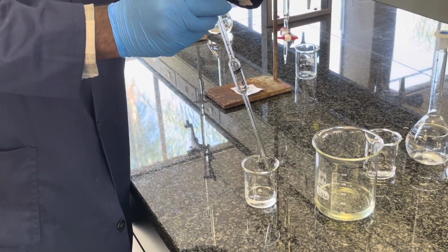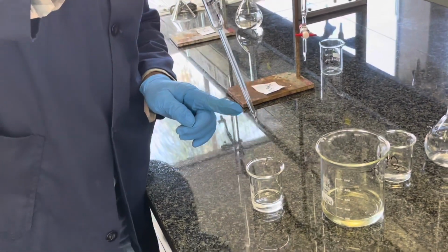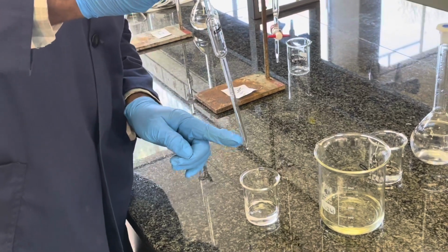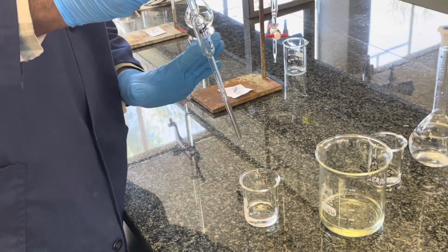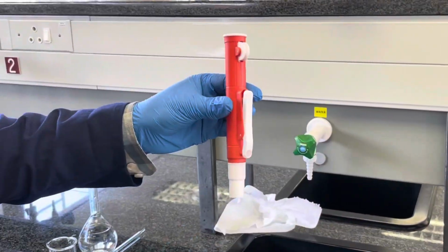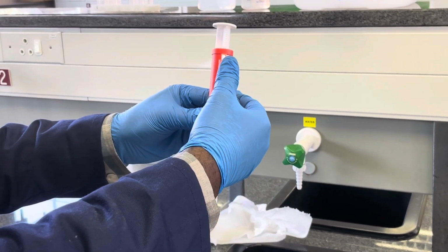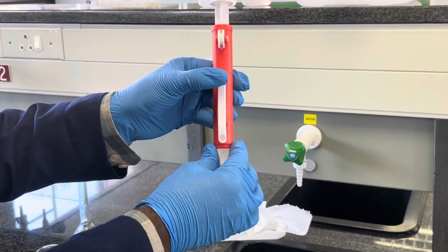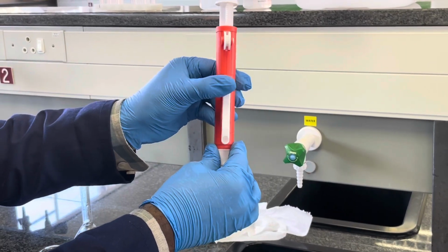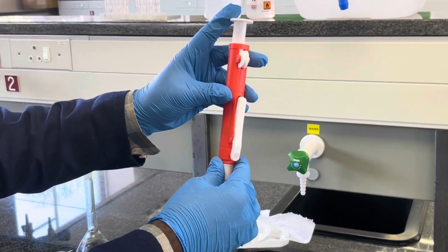Remember, once the end of the solution is reached with the pipette, the last droplet won't necessarily be dropped out of the pipette. It will be kept in the pipette. Another type of pipetting device you might encounter in the lab is called a suction pump. This device works as follows. You will have a turning wheel to suck up, and you'll have a dispensing knob which you can push to dispense your solution after you have sucked it up.